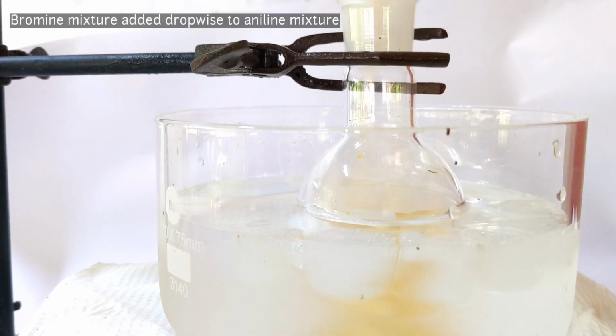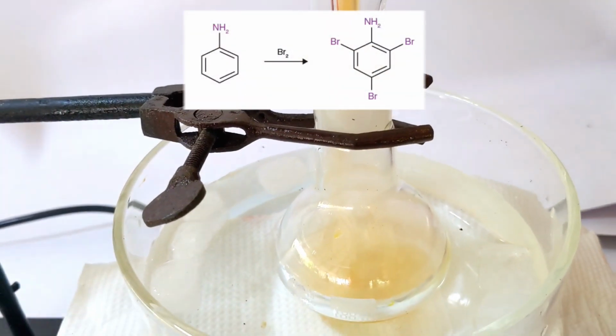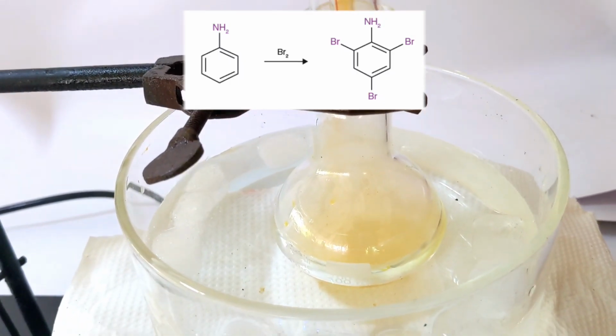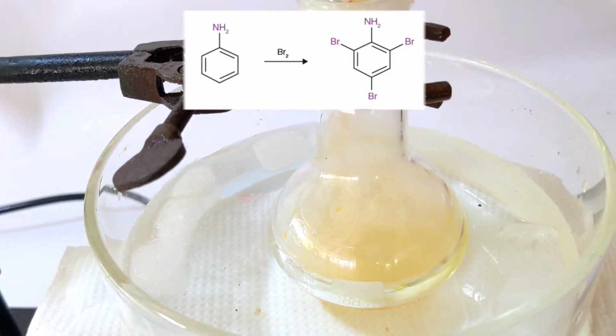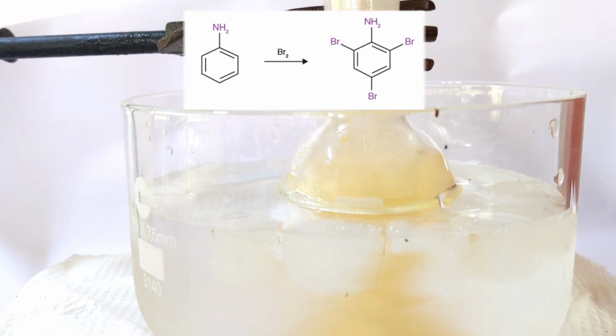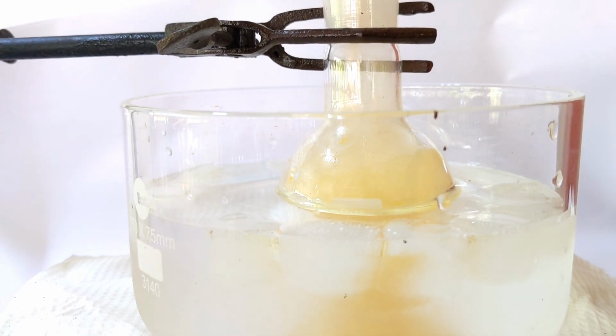The reaction that is occurring here is an electrophilic aromatic substitution reaction, where 3 molecules of bromine combine with aniline and the amine group directs the bromine to 2 ortho positions and 1 to the para position, forming the 2,4,6-tribromo compound. The reaction is exothermic, therefore I used an ice bath just in case to prevent bromine vapors from escaping.